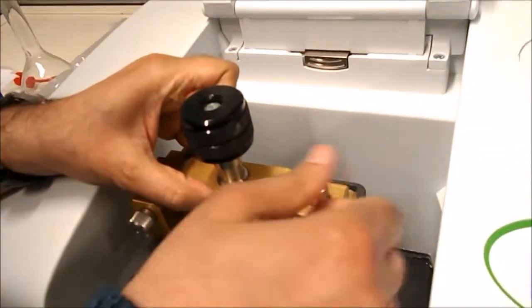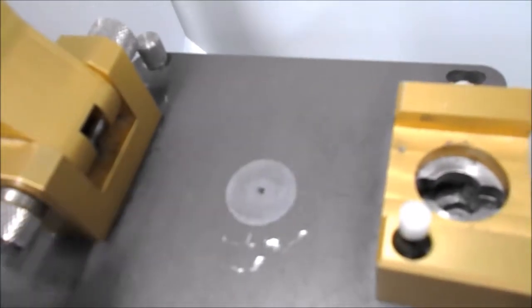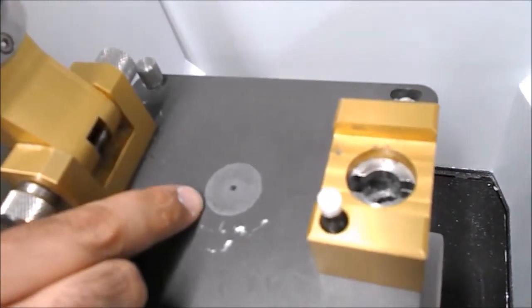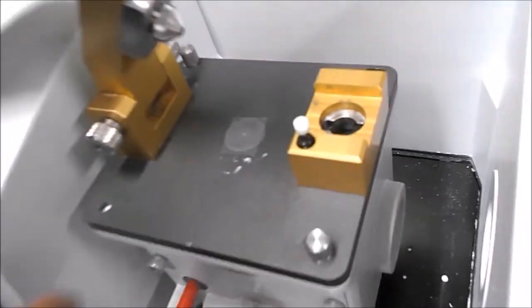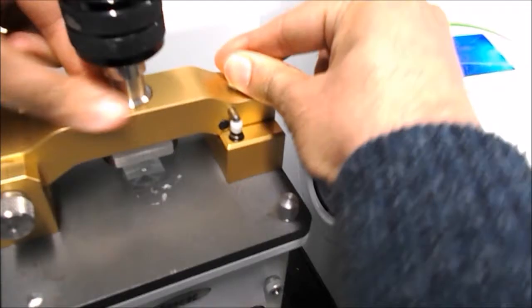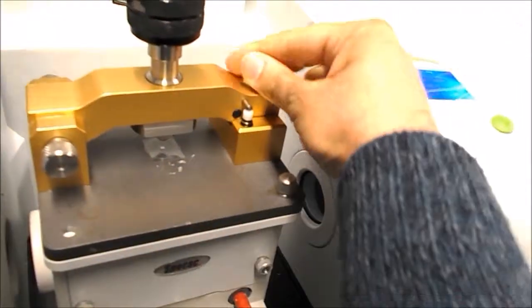That's the FTIR window. So we just press it down and rotate it, lift it up. This little thing here, that is where the detection happens. So whatever sample we have, liquid or powder, has to make contact with that window. So I'll just use this plastic acetate sheet. I'll put that on the window, close it. So once you close it, you need to rotate this knob here. And then you bring this down.